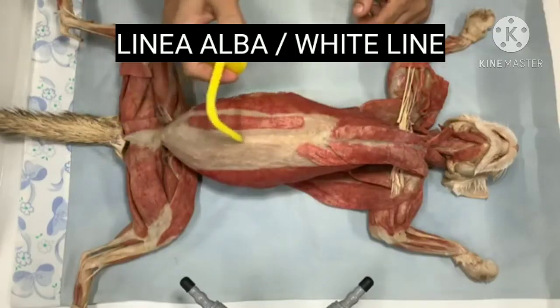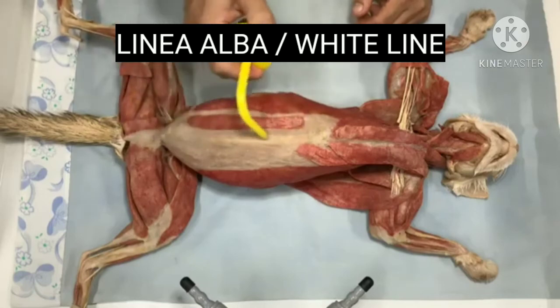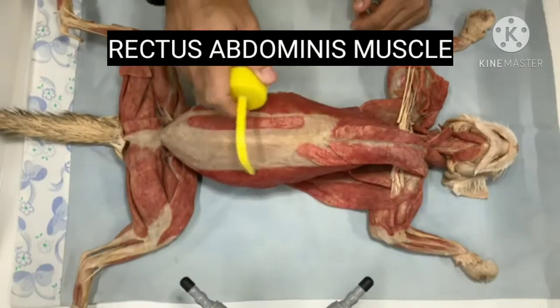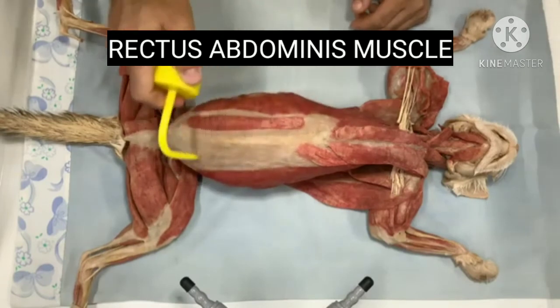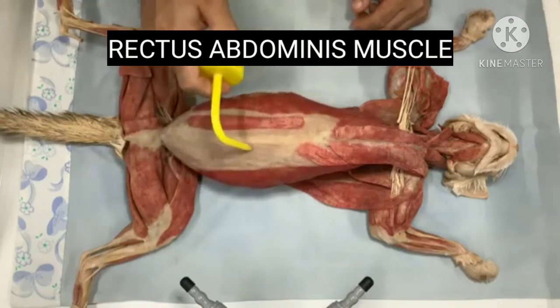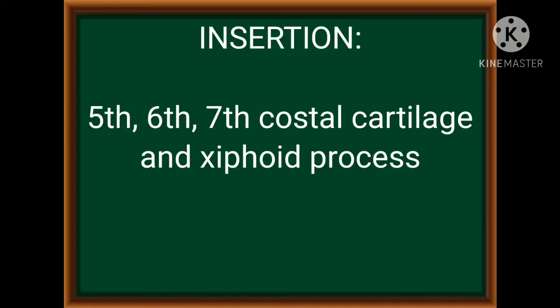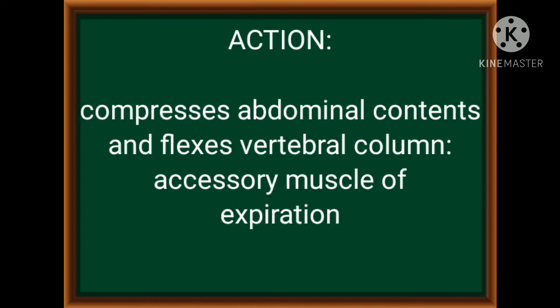Now let's go to the linea alba or white line. Now let us proceed to the rectus abdominis muscle, and now let's go to its OIA. Symphysis pubis and pubic crest. Fifth, sixth, seventh costal cartilage and xiphoid process. Compresses abdominal contents and flexes vertebral column, accessory muscle of expiration.